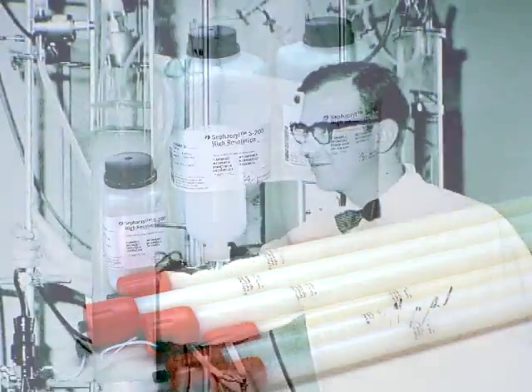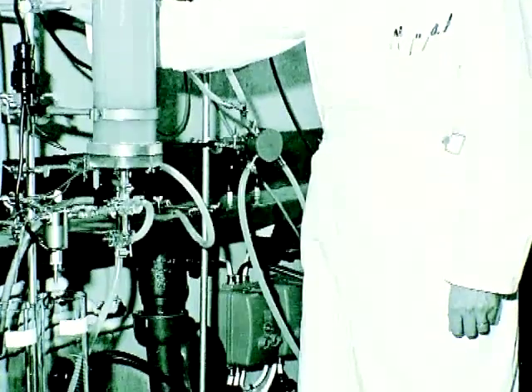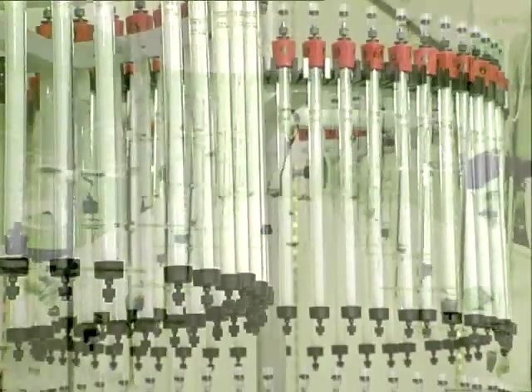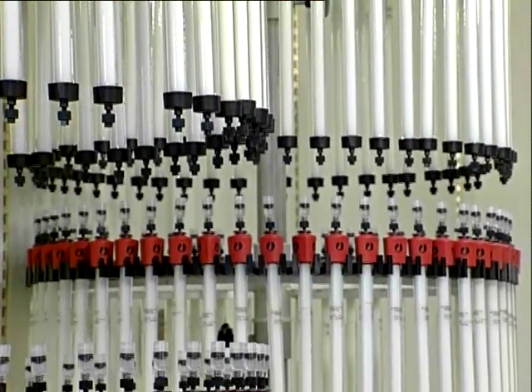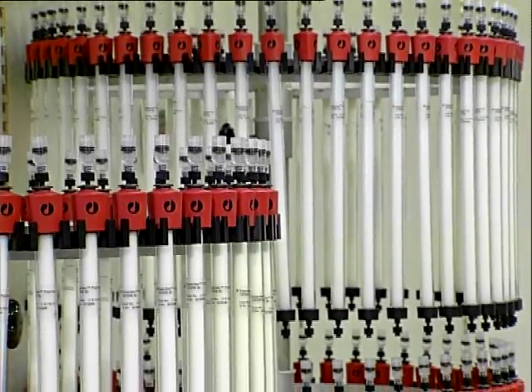In addition, we pour over 40 years of experience into every pre-packed column. The remarkable array of media and columns we offer also poses a challenge — the combinations are enormous. A pre-packed column may not always be available with the exact specifications you demand. In this case, you have two options.